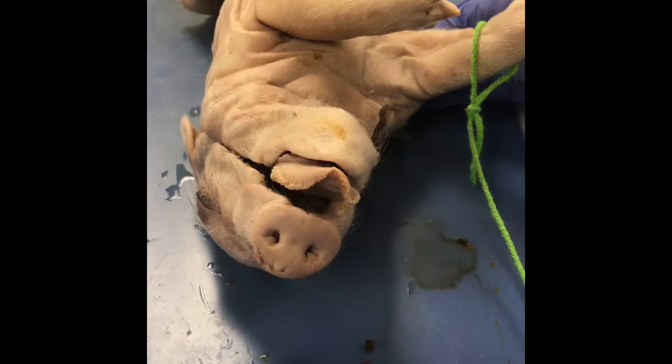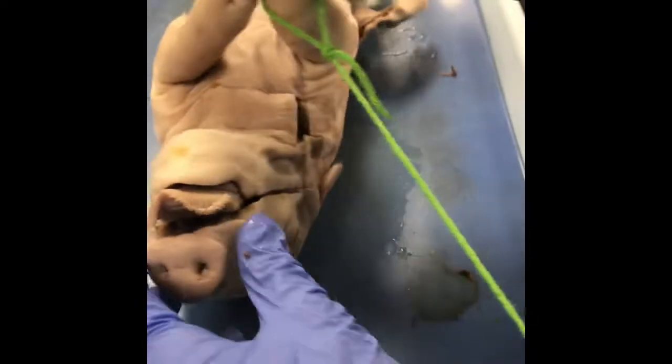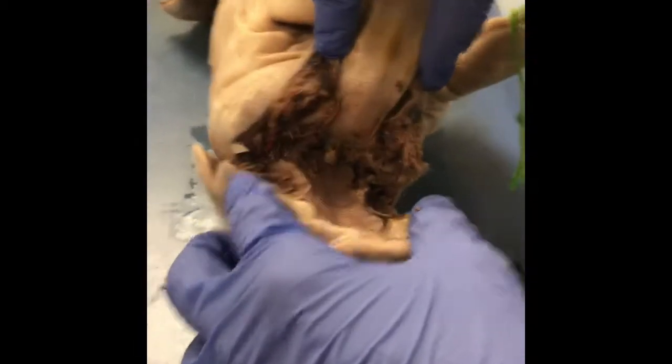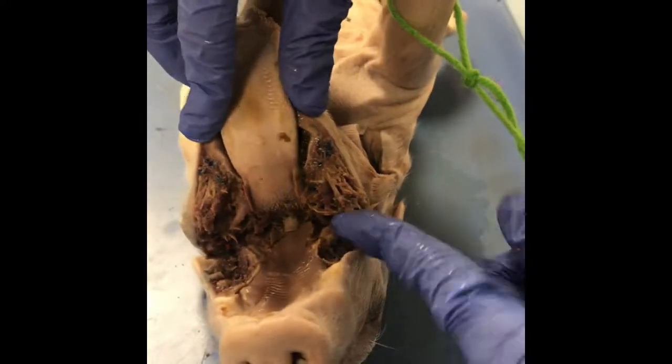After cutting the jaw, we will now open it to view the epiglottis. So again, you have the chin. You cut the jaw down to the bottom of the ear. You open it up. You're going to have to break it and cut these little strands.